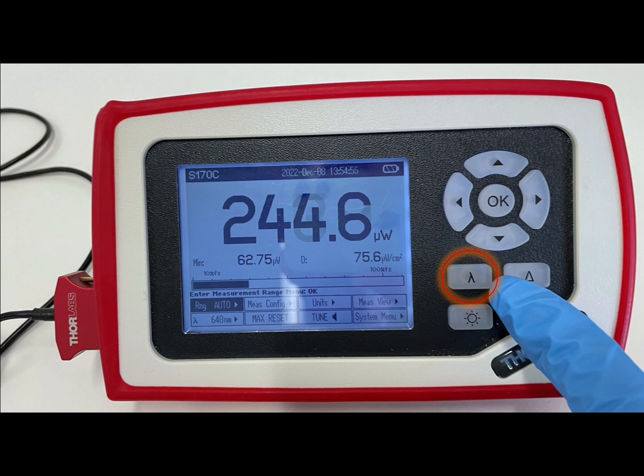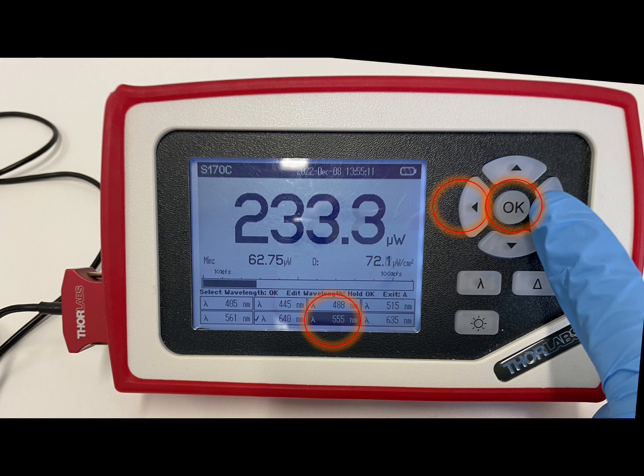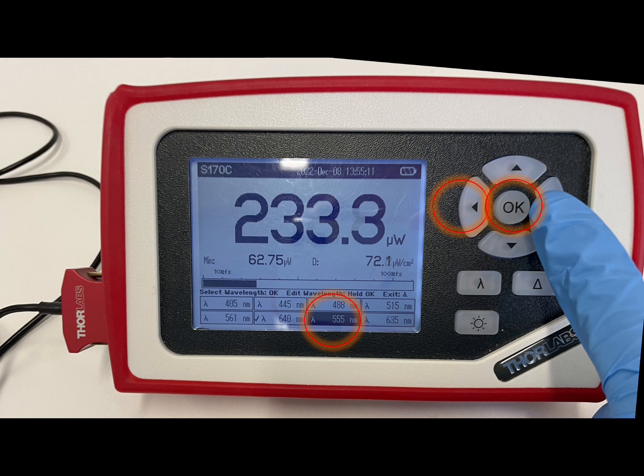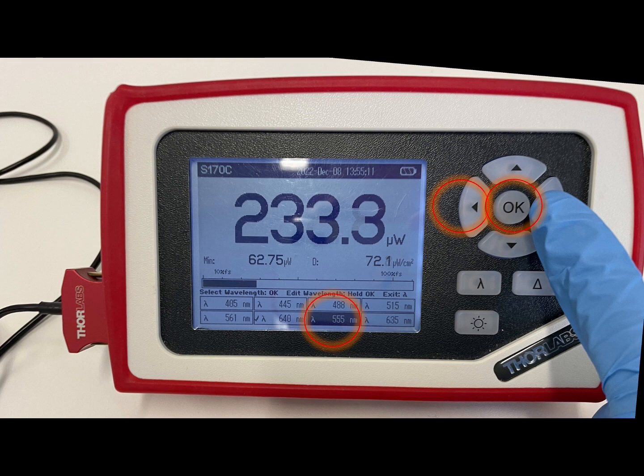Set the wavelength you want to measure by pressing on the button marked with lambda. The bottom of the display screen shows a menu with the different wavelengths already entered by the operator. To enter additional ones, please refer to the user manual of the powermeter. One can navigate between the different wavelengths with the four arrow buttons on the right of the screen. The selected wavelength appears highlighted on the screen. Press the button OK to use this wavelength for the measurement. This will also bring you back to the main menu.